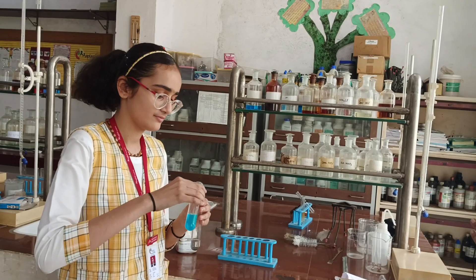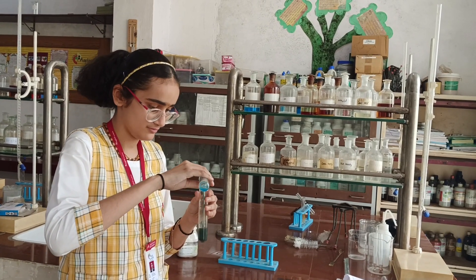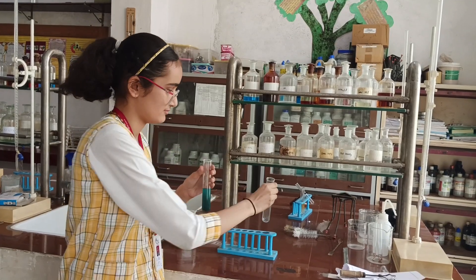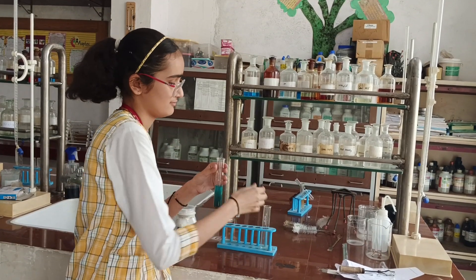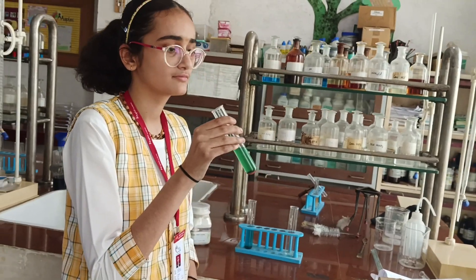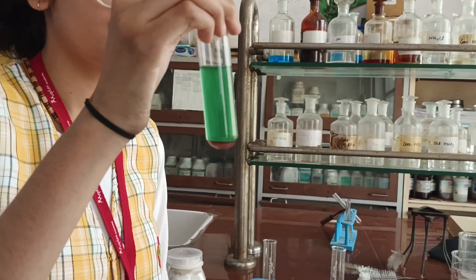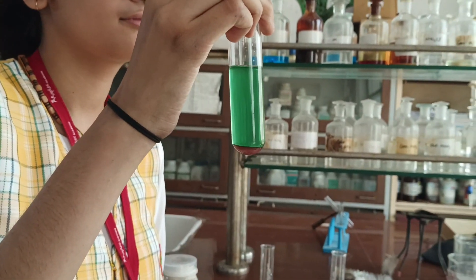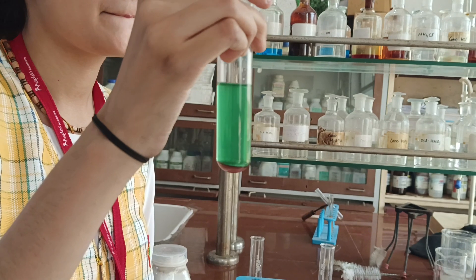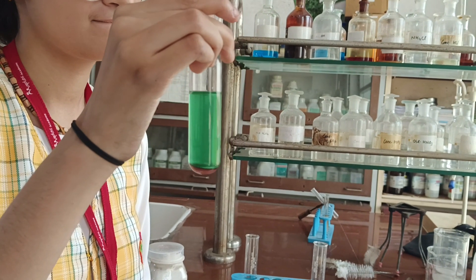In this reaction, we mixed copper sulfate with iron and stirred. After five minutes, copper appeared as a precipitate in red color, and ferrous sulfate is present in green color.